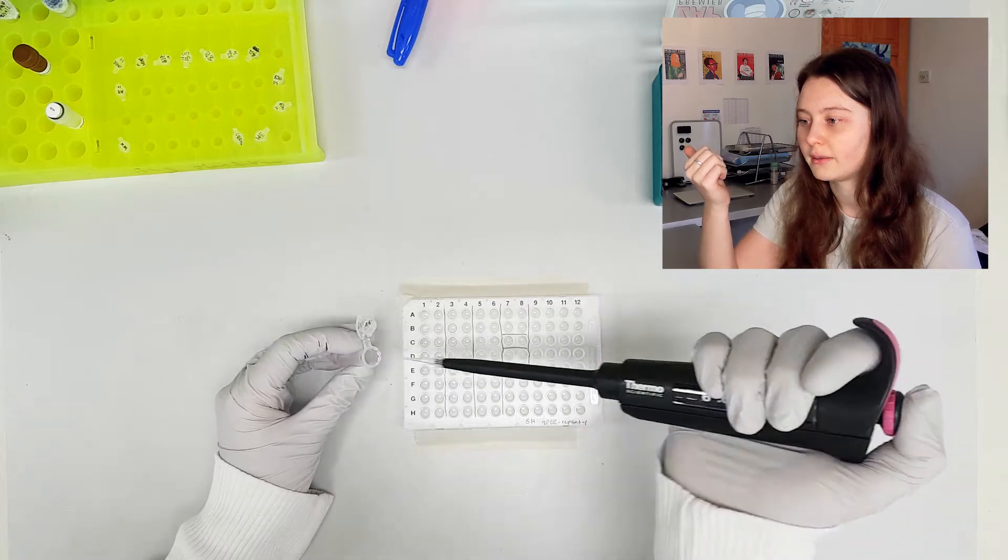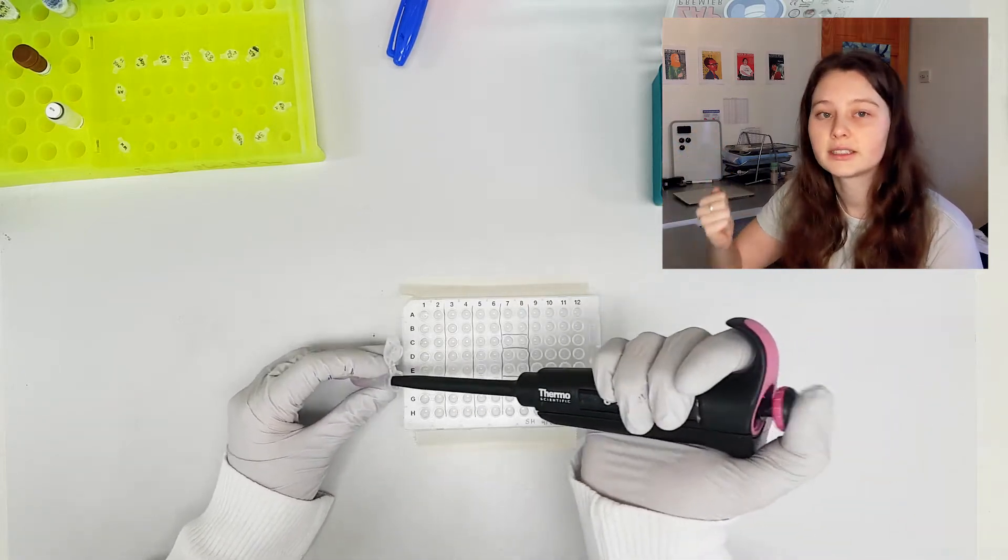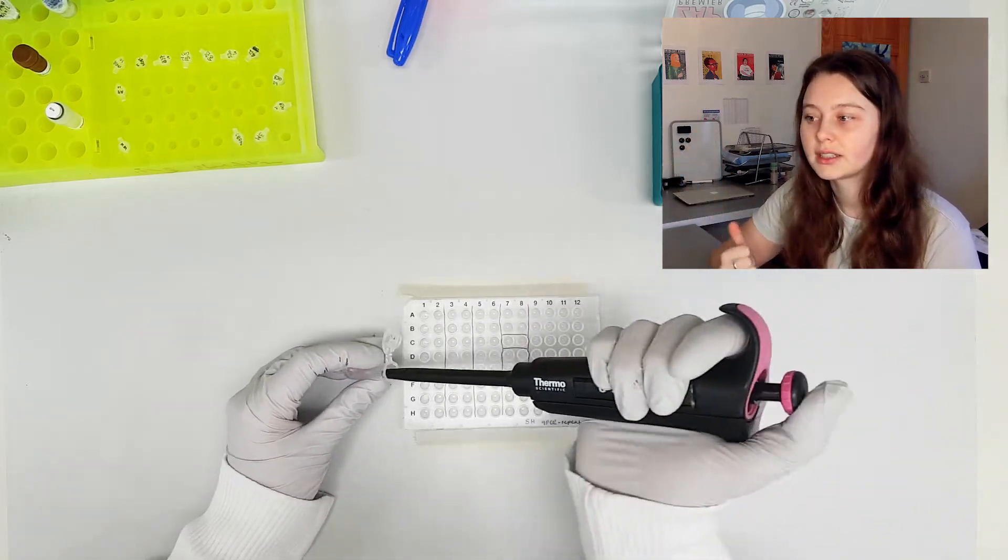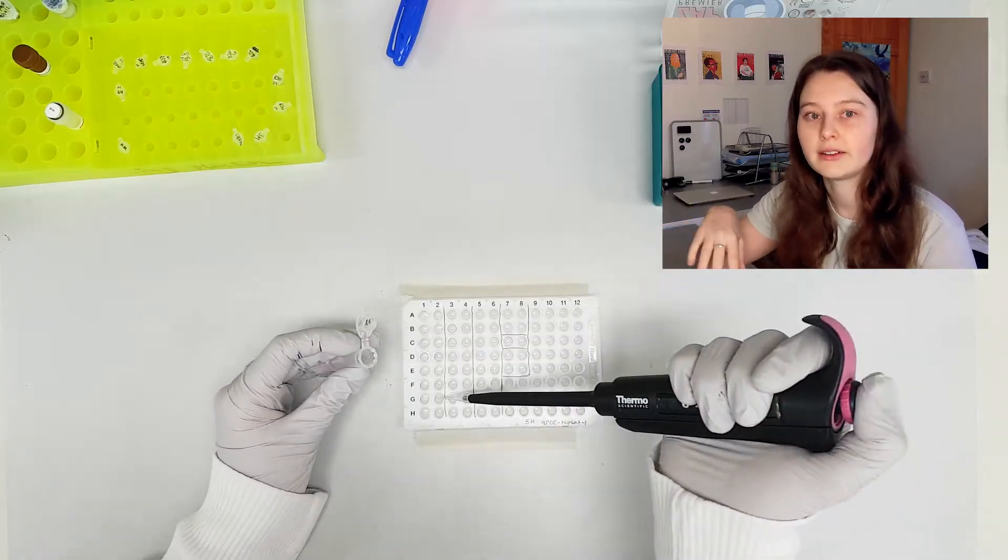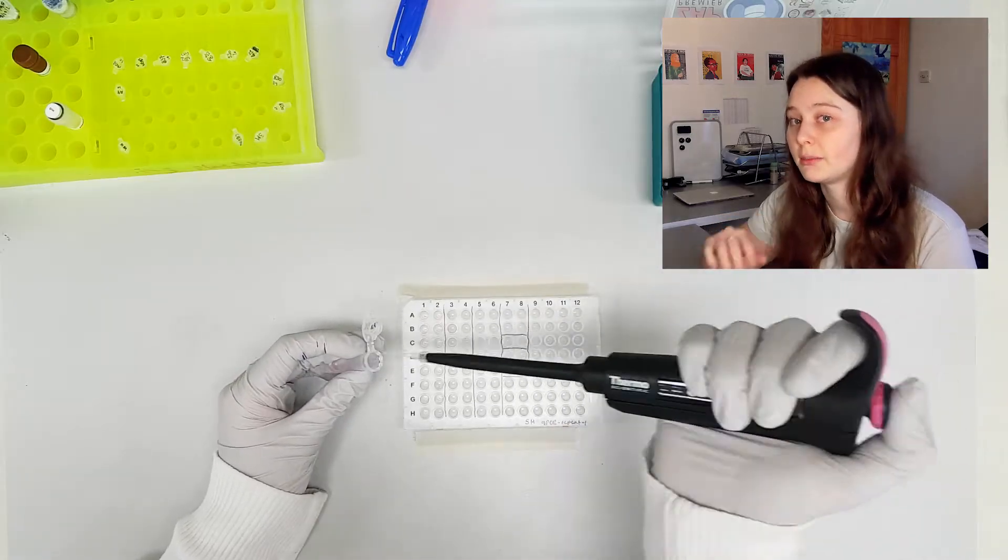So you can see that I'm pipetting the master mix into every single well. It's a very repetitive process, there's nothing different. Everything in that master mix needs to be in every single one of those wells that I'm about to use.